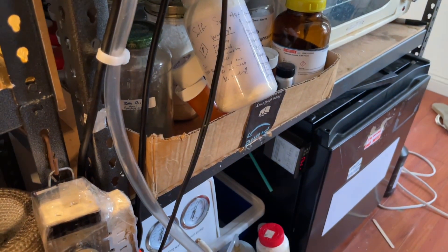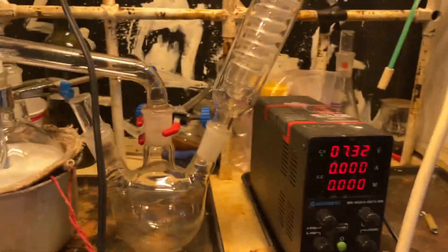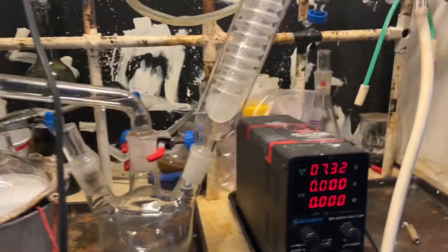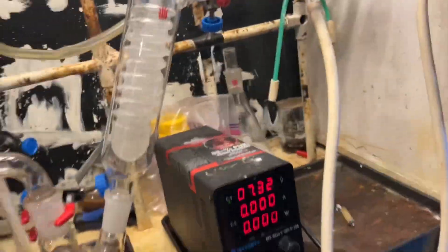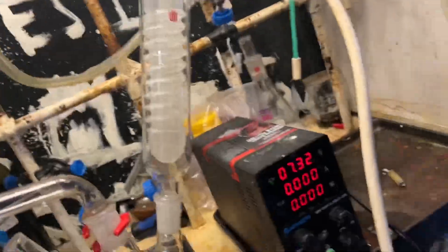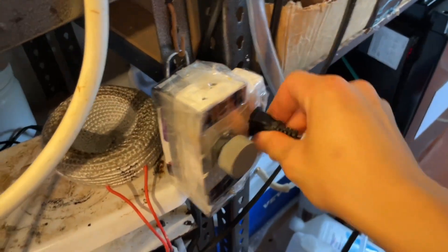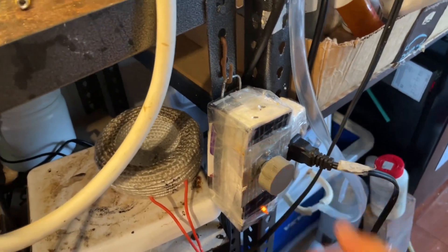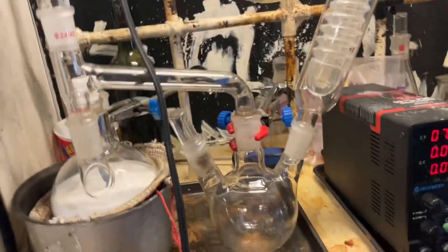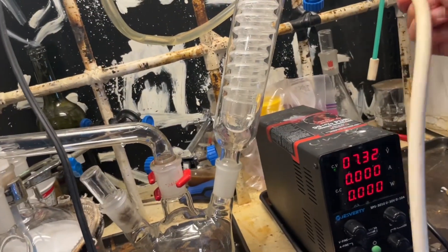Let's turn on the vacuum. And vacuum meter's going down. That's good. Turn on our water cooling. And plug in our heating mantle. I need to shorten this cord far too long. There we go. Turn this on. And vacuum's still dropping. That's good. Though, I think I'll shut off for now. We can pull the vacuum once everything's warmed up.